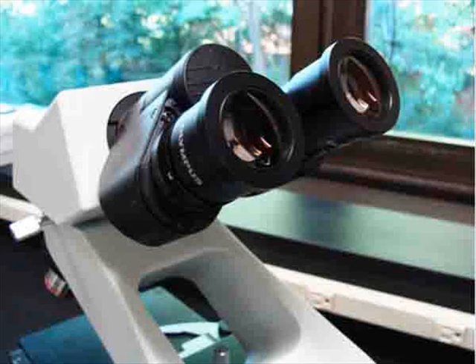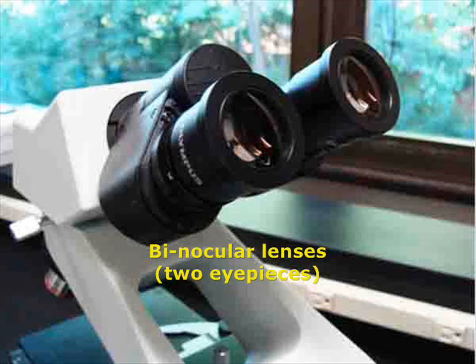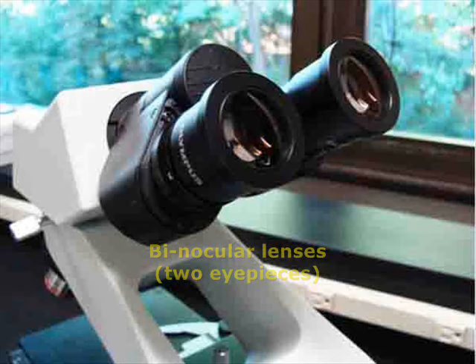Compound microscopes have either a single ocular lens or a set of binocular lenses. The ocular magnifies the specimen ten times actual size.